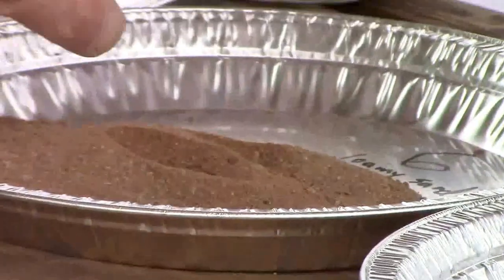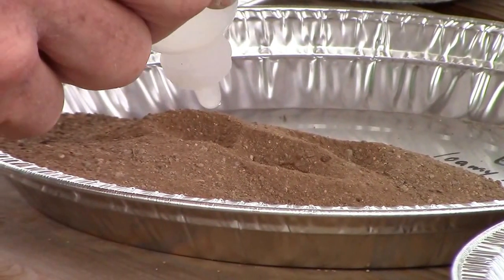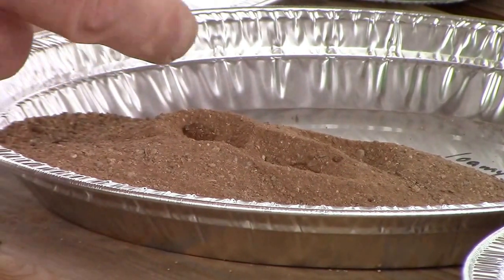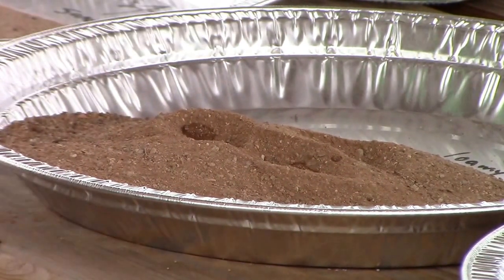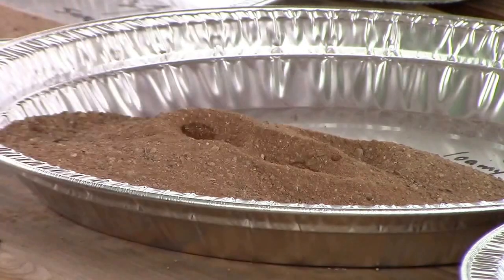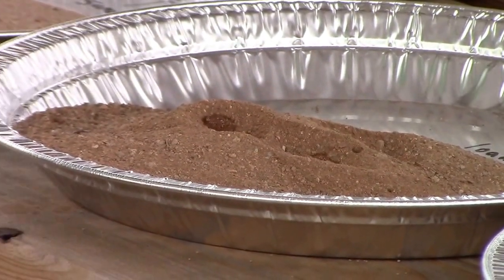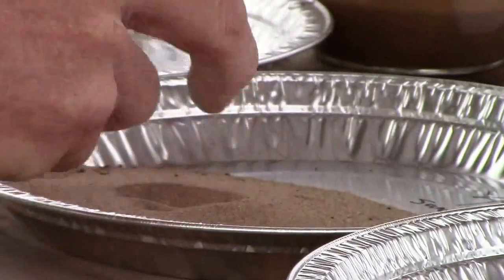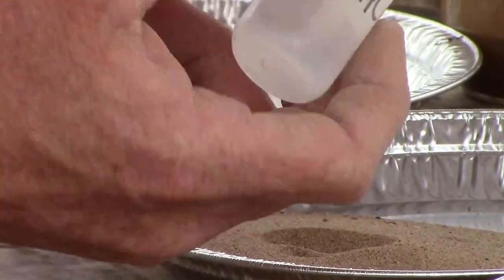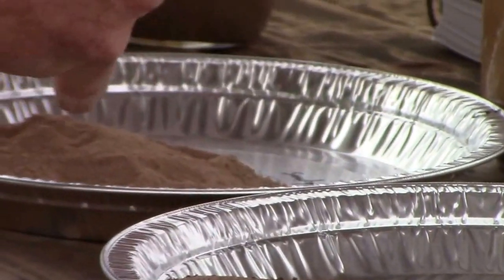Very slight — this one has very little carbonate in it. On the second and third test, just a very low mound of bubbles; it's defined as numerous bubbles forming. This is sand — non-effervescent. Drop the acid on there and it's just like dropping water. Nothing happens.